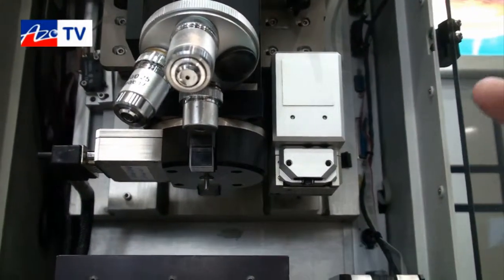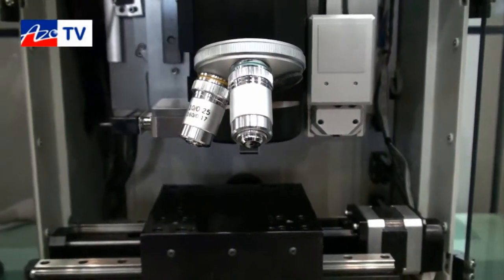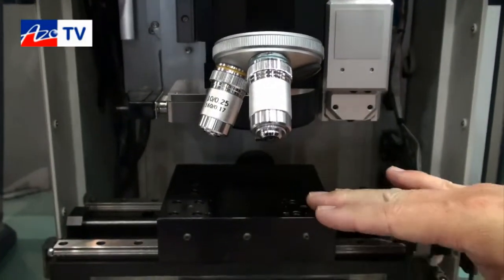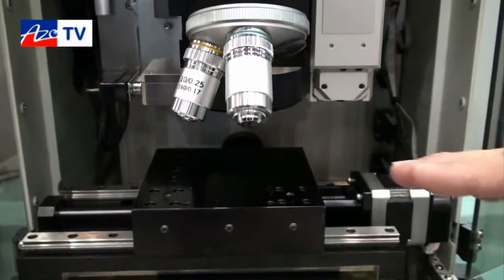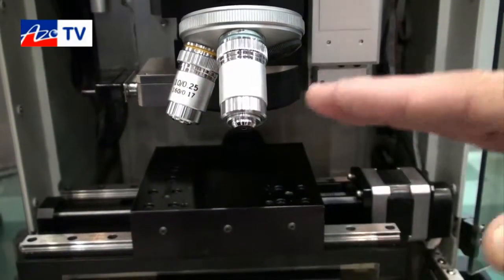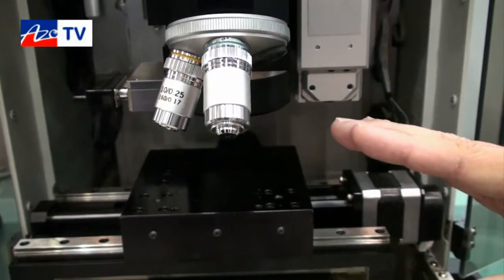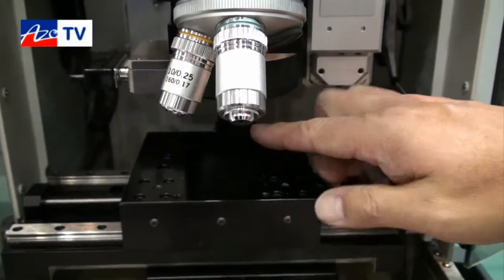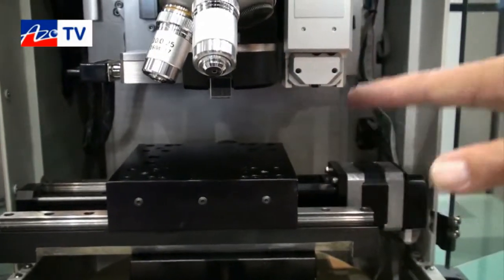The sample is normally set up on a puck — it's a metal cylinder — and it's mounted on this XY table. Basically, between the three components, we set up the test such that initially with the optical microscope we determine the position for the indenter, then we produce the indentation, and after that we can scan the indent with the AFM.